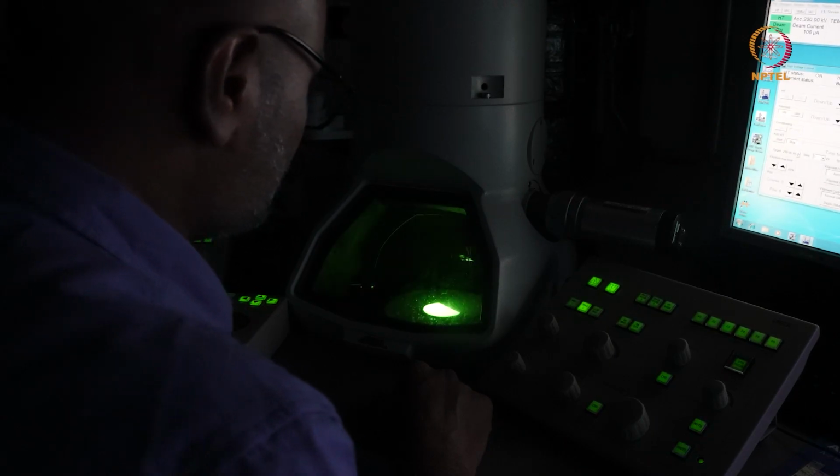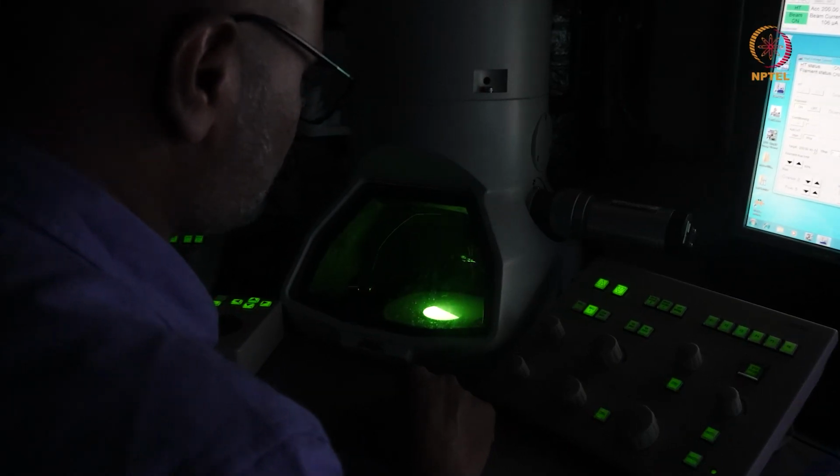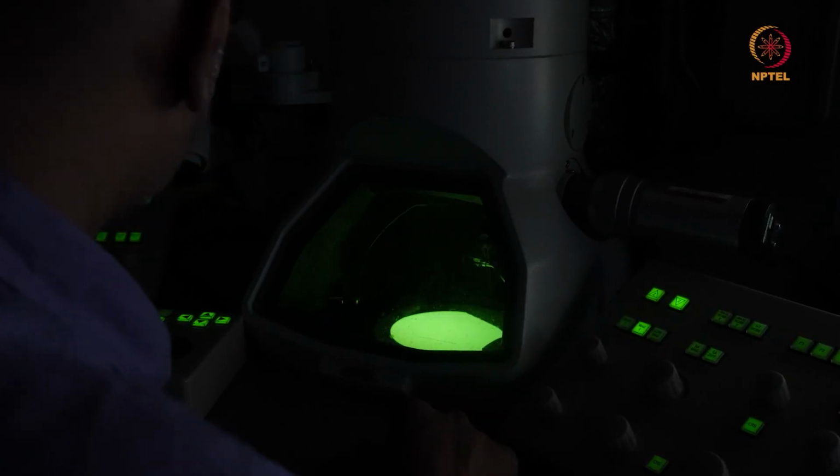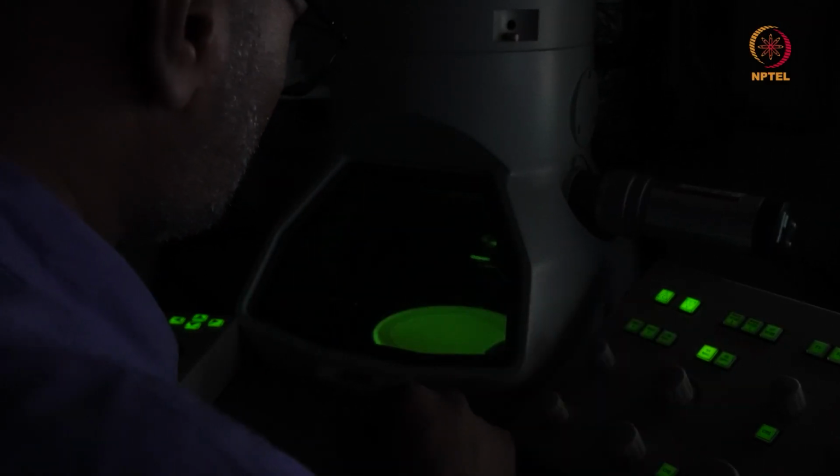Typically for electropolished samples or 3 millimeter discs, where you form a small hole by either electropolishing or ion milling, finding the hole is the first step. And once you're close to a hole, you know that the area adjacent to the hole is an electron transparent area. So for example, when I switched on the beam, I spread the beam like this.